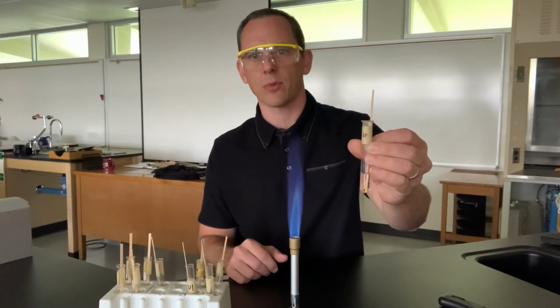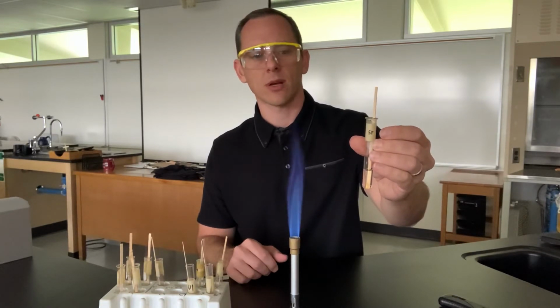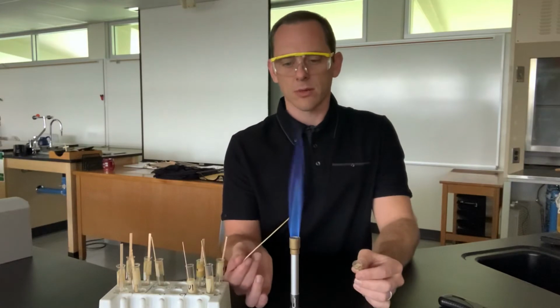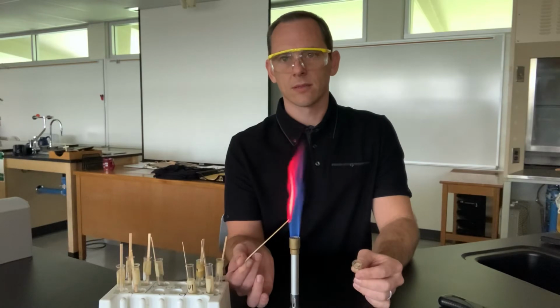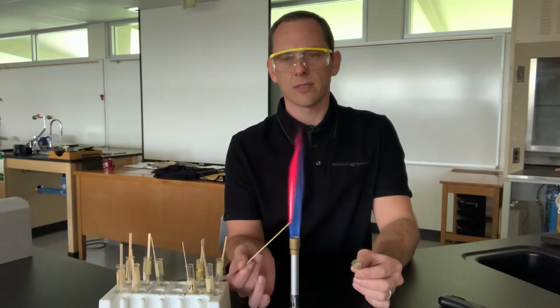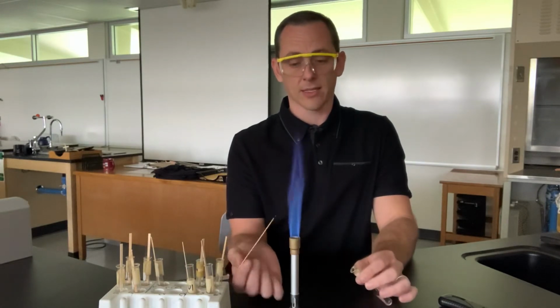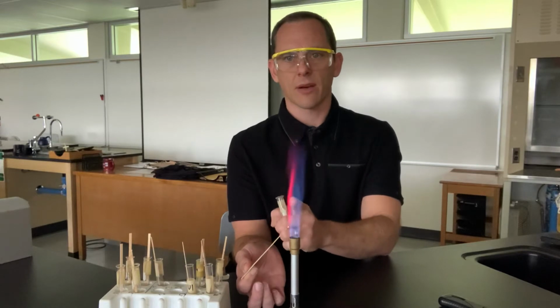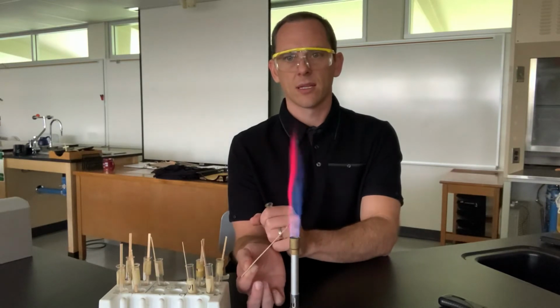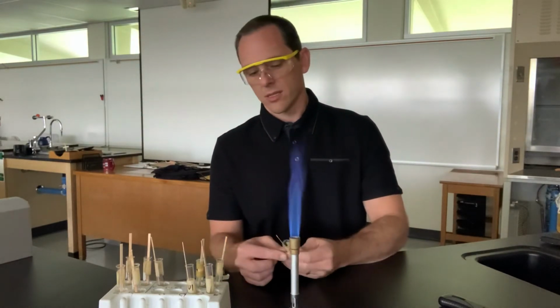I know that things are backwards for you. Well, they are on my screen. Maybe when it records it flips it. But strontium is Sr. Put strontium in. Okay. So strontium is kind of like a reddish color. Whatever you want to call that, it's up to you. So we see the real bright area down in here that's showing up on the iPad. But the characteristic is that sort of reddish color up above. That's strontium.